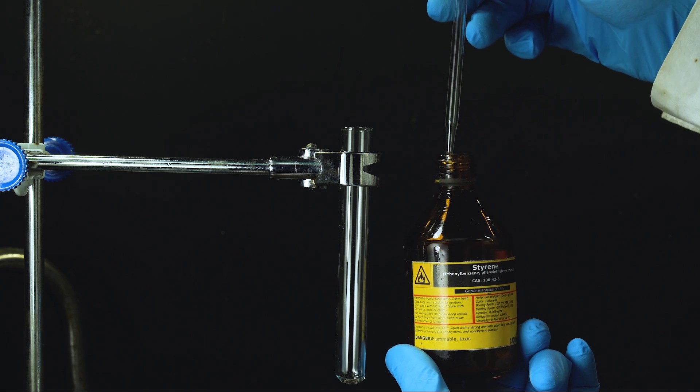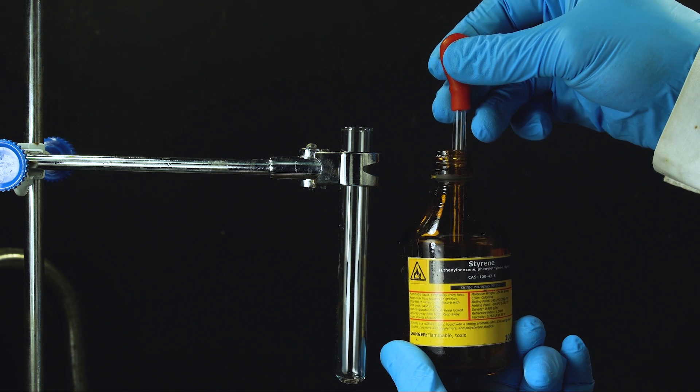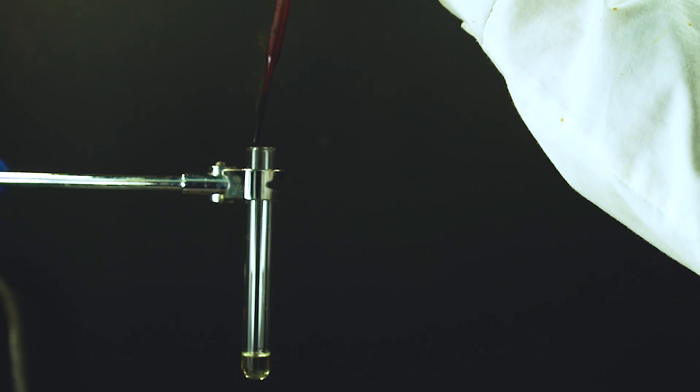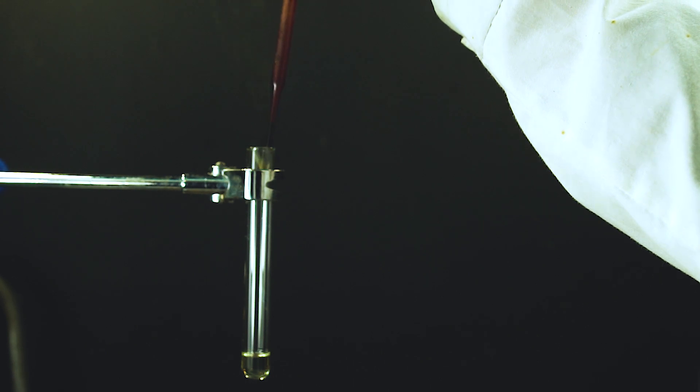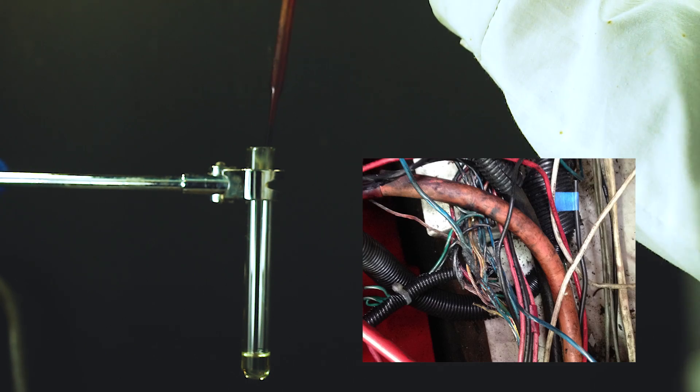As far as styrene oxidizes easily, I decided to try to affect it with the help of chromyl chloride. By the way, you can imitate the smell of burnt wiring with that of styrene.